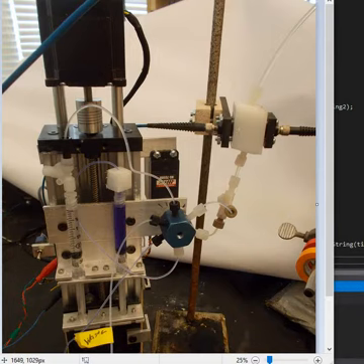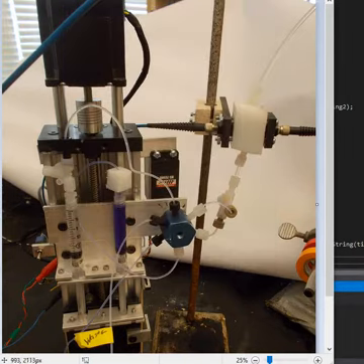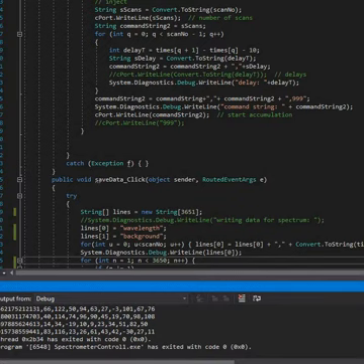It has fiber optic fittings that let light into the cell and let light out to the spectrometer. The spectrometer we're going to use is this Thorlabs CCS100 spectrometer. It cost us about $2,000, and the apparatus here cost about $1,000 to make. So this is, in scientific equipment terms, rather inexpensive, and that's our goal, to come up with something inexpensive. So that's what the hardware looks like.